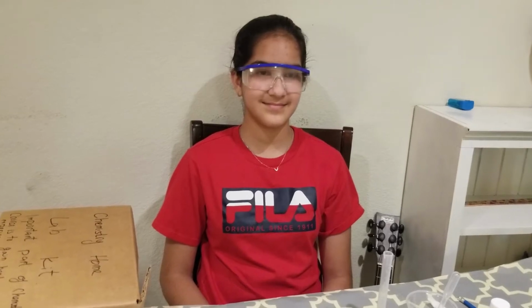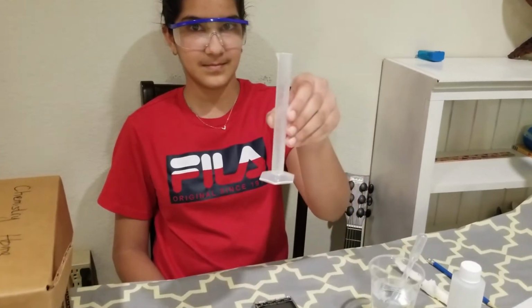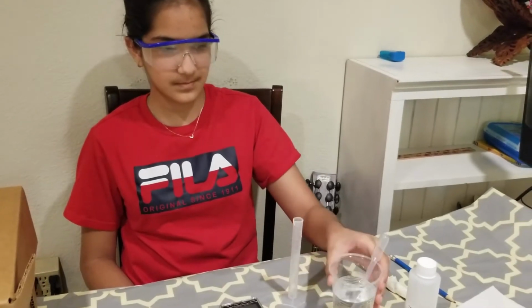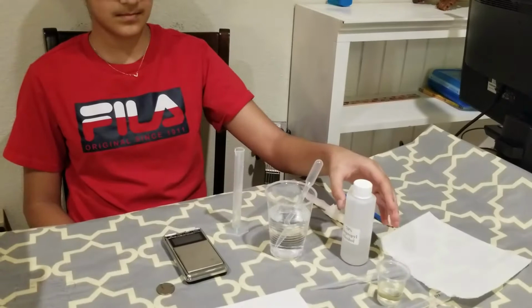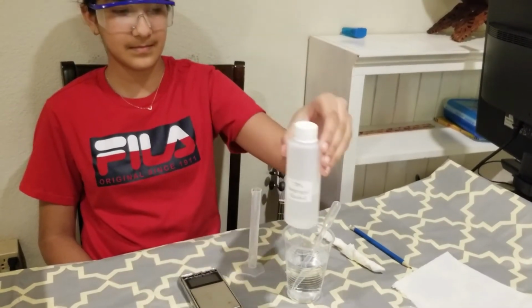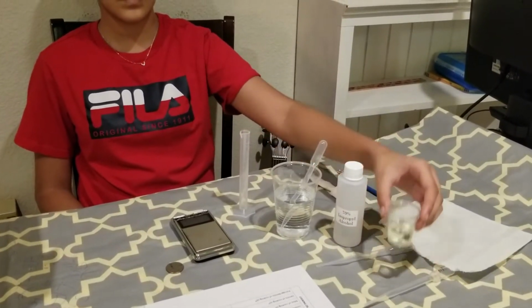In this video, Laiba will help me demonstrate measuring density, part A, which is density of a liquid. In this part, we need a 10 ml graduated cylinder. We need water. We need rubbing alcohol from your home lab chemistry kit. And we need cooking oil from your kitchen.